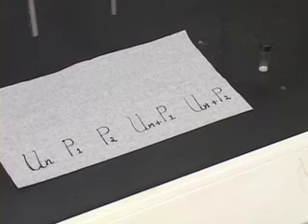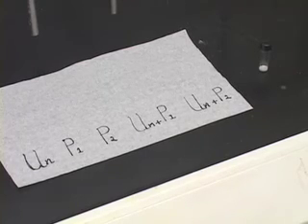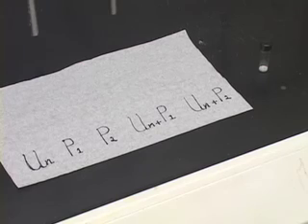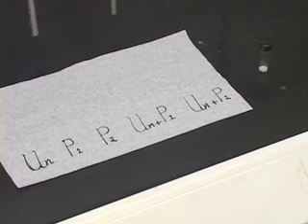So that completes today's experiment, and now I am going to show you how to use the Hoover apparatus to determine the melting point.